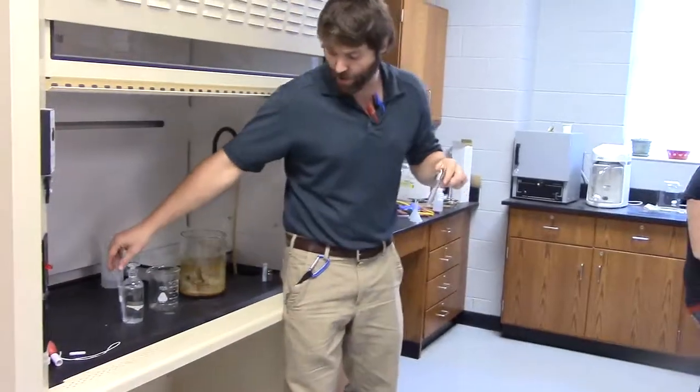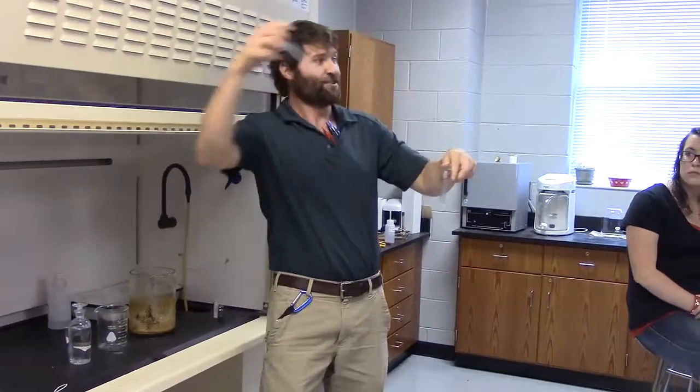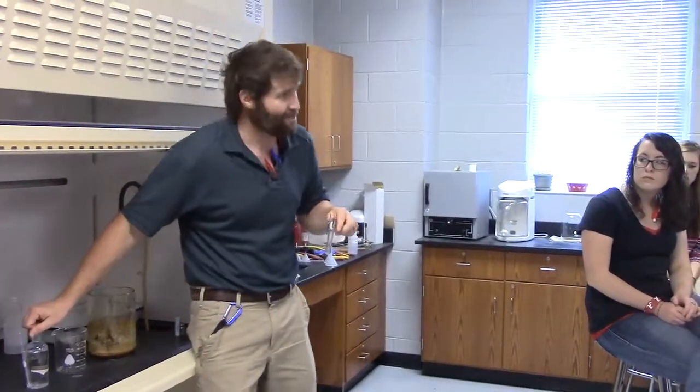But make sure that when you are done, what happens if you got too much HCl in here? Should you suck it back out and put it back? No. Nope. There'll be a waste container back here. You dispose of it in the waste. When you're done, put the pipette back in this little thing. Make sure you put the lid back in it.